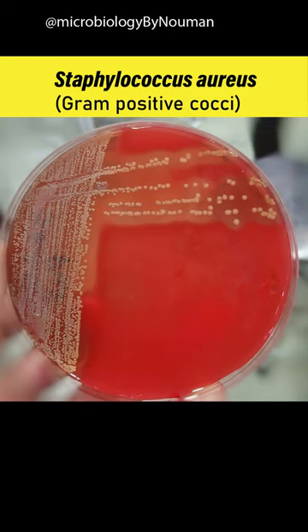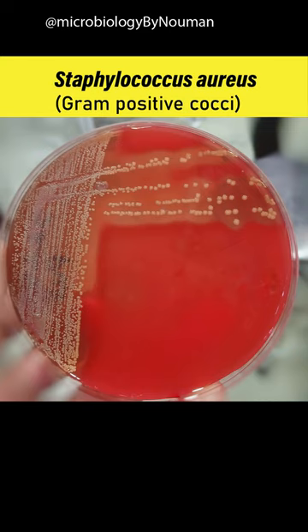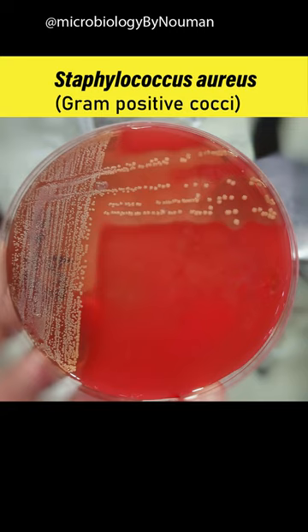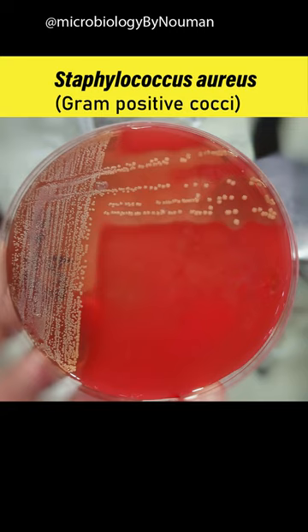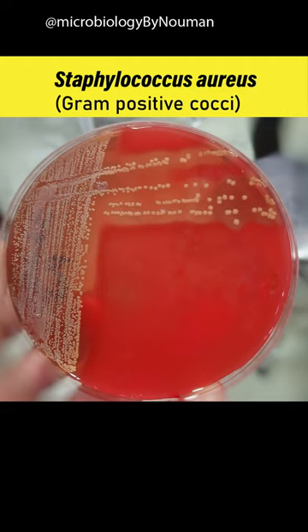This is a blood agar plate, a culture media used in microbiology. This plate is showing growth of a bacterium, Staphylococcus aureus, also known as Staph aureus.